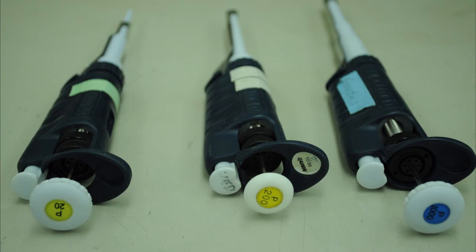Here you see the P20, P200, and P1000. These have a manual volume setting and can be found in any upper level university lab.